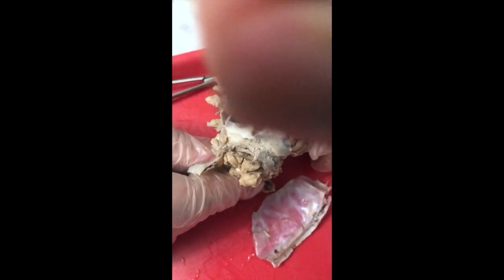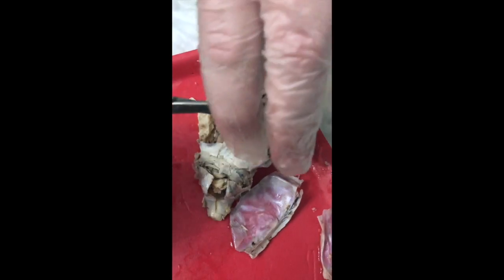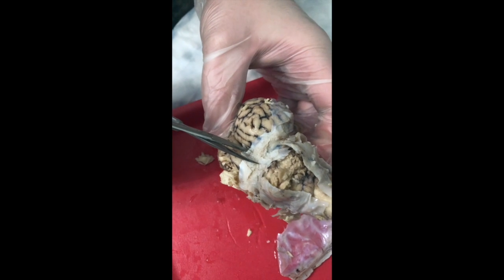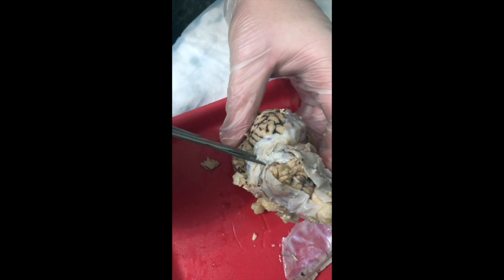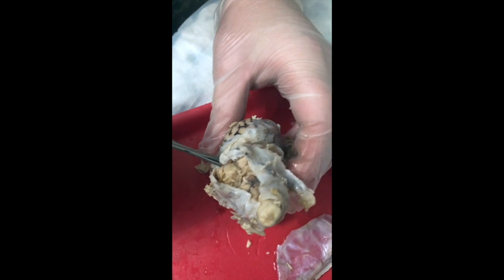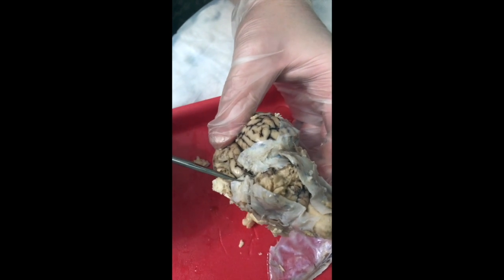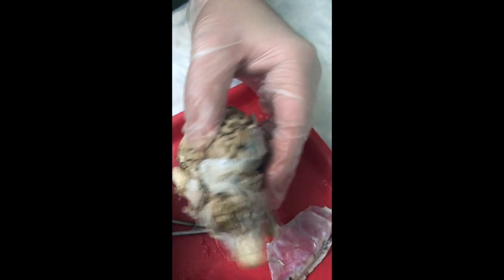We need to take our scissors and go straight down to cut this really strong ligament. So we're going to take our scissors and go straight up and down. This way. Lift your hand, point the scissors into that. This? Yep. And straight down. And you'll hear this crunching as you actually go through it. It's an extremely thick structure. And again, it's designed to suspend the brain in the cranial cavity so it doesn't bang around against the skull bones.